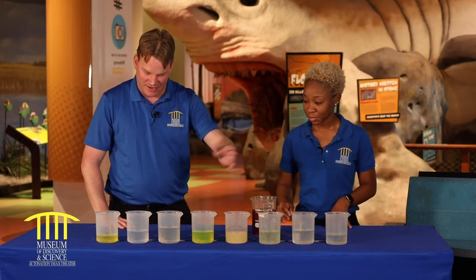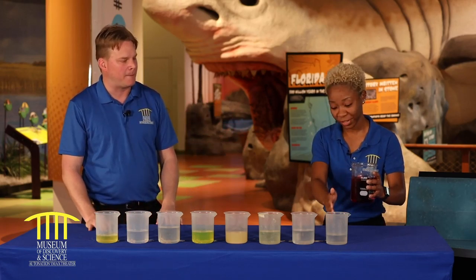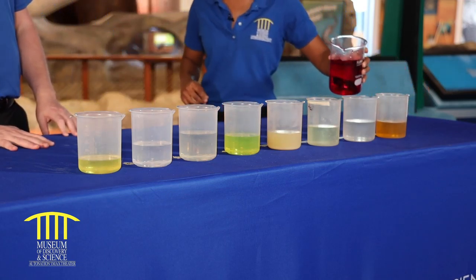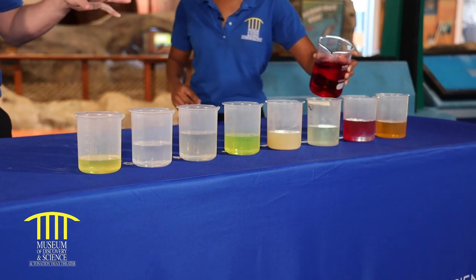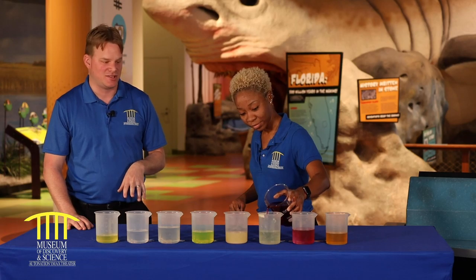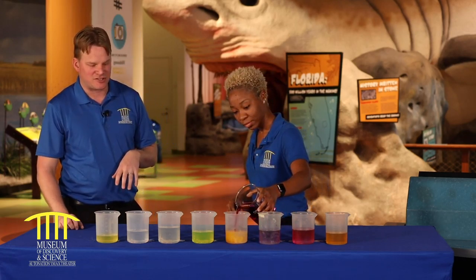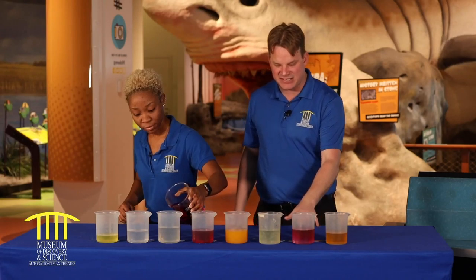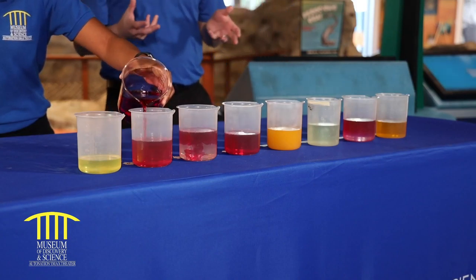We're just pouring our indicator into our liquid here — these are random liquids. We're pouring a red liquid into these and getting some odd results. We're getting different colors, different shades that are starting to occur. Starting way on the left, we poured red into a white liquid and got a yellow liquid. We've got about the same here, a little bit different shade. This one didn't change. This one was orange. As you can see, they're doing very different things.